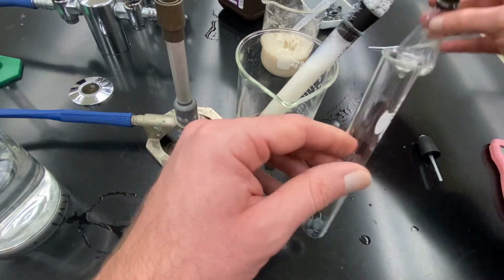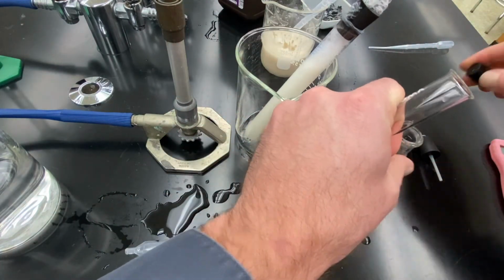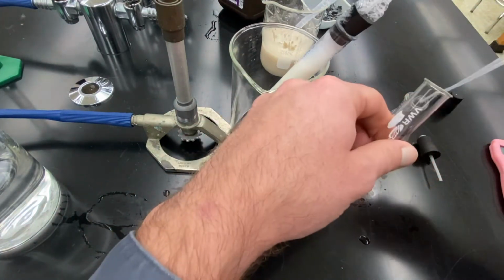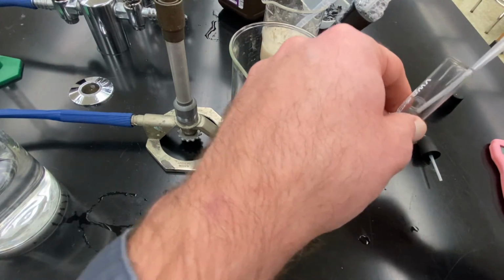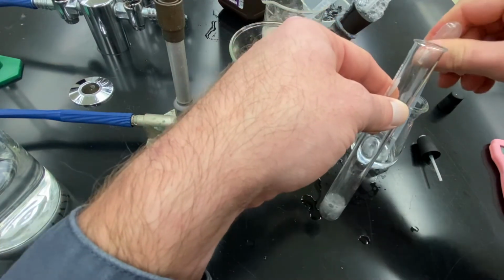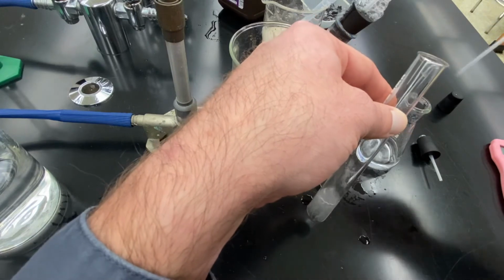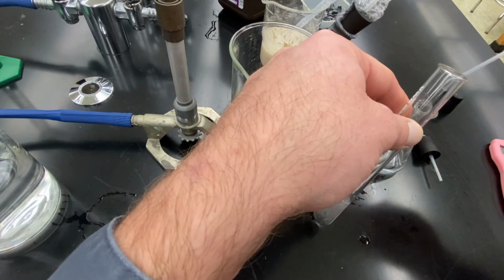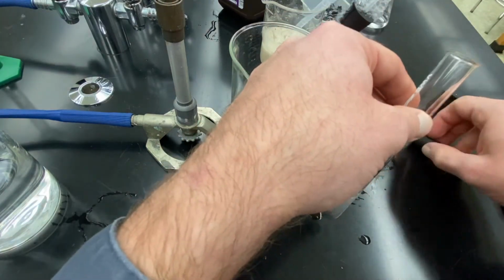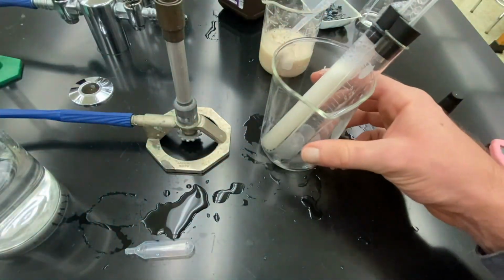And next I have some hydrochloric acid. This is 3 molar hydrochloric acid. I'm going to take some and add 2 or 3 pipettefuls, and I could see that it's already dissolving the metal and producing hydrogen gas in a very exothermic reaction. And so I could set that aside. I put my nozzle on the top, and there we go. We have our 2 gas generators.